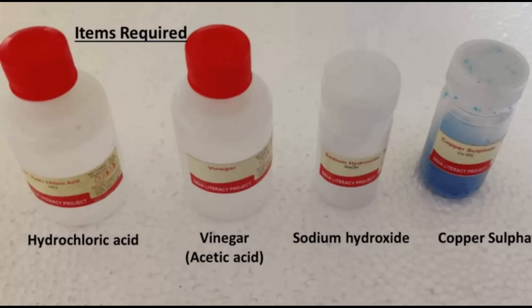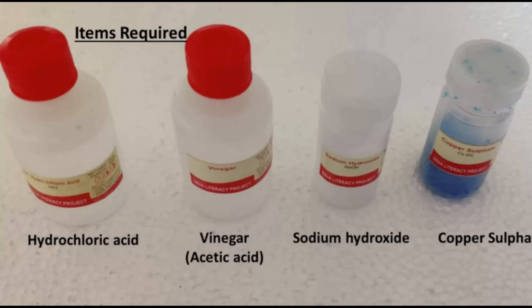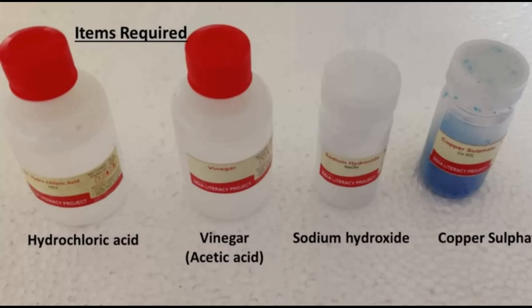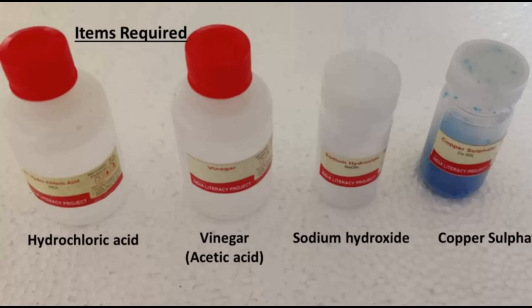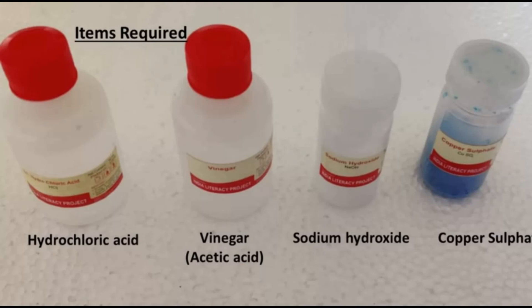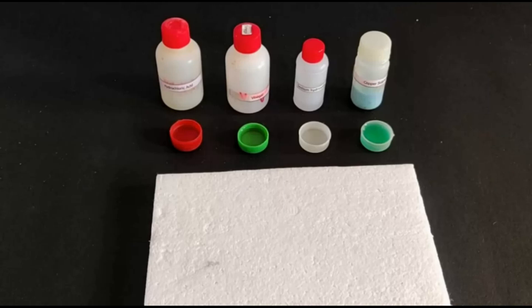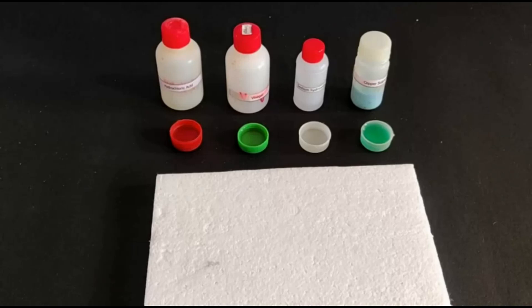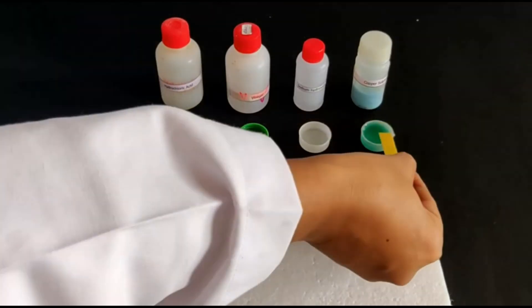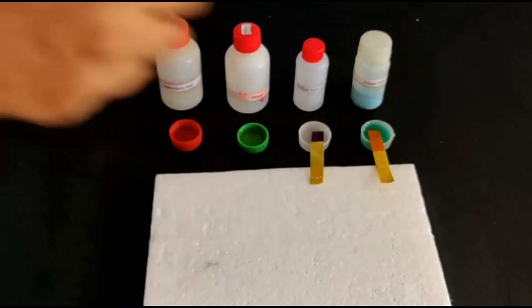First of all, we have to prepare the diluted solutions of these chemicals: hydrochloric acid (HCl) and vinegar (that is acetic acid). We have to test these chemicals and observe the pH values. By comparing the pH values, we have to say whether it is a strong acid or strong base. Here, we have prepared four diluted solutions and now we are inserting pH paper in each solution and observing the color change of the pH paper.